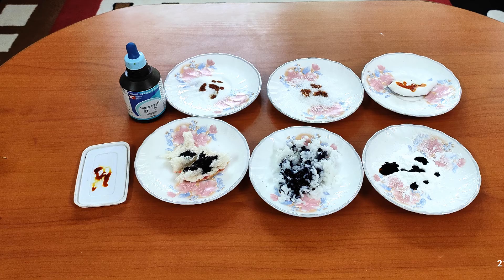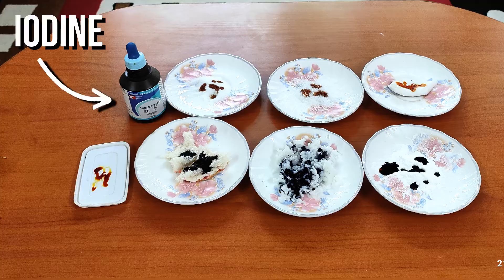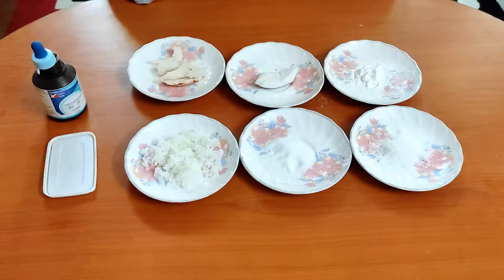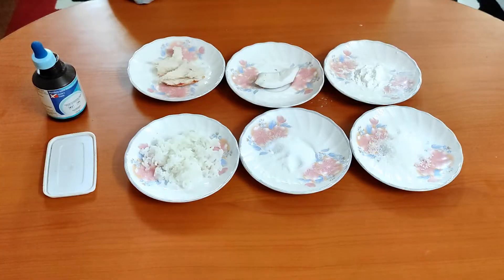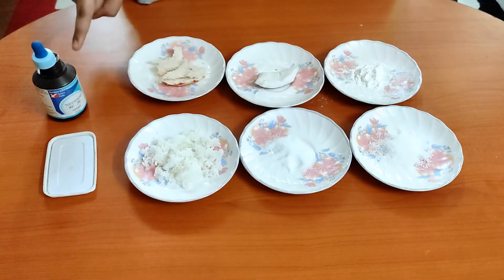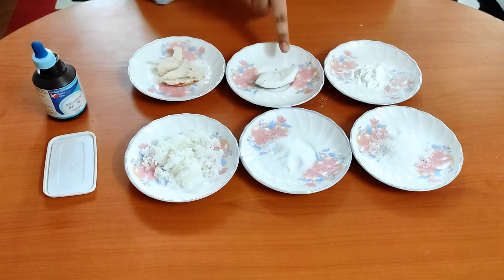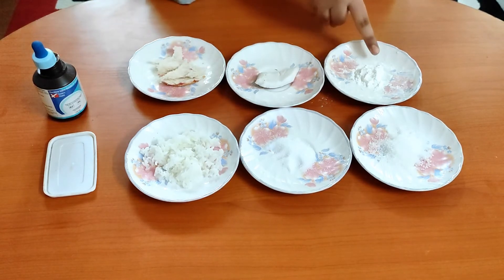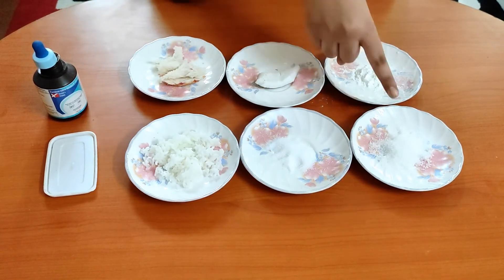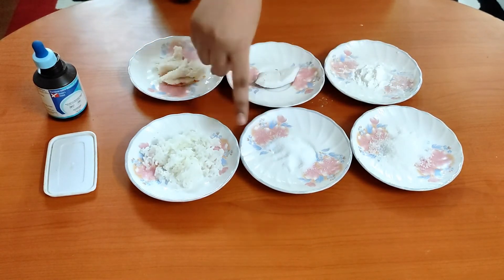In today's video, I will demonstrate a test for starch in various food items using iodine. For this activity, we need iodine, bread, coconut, cornstarch, sugar, salt, and rice.